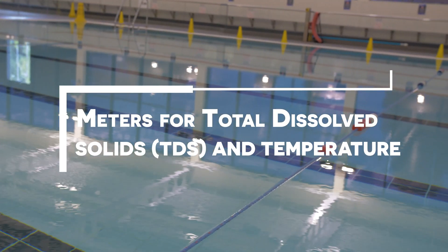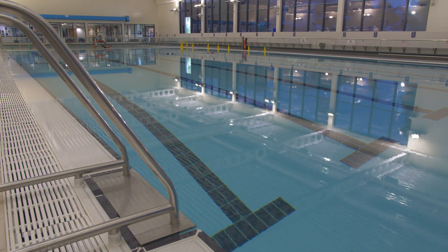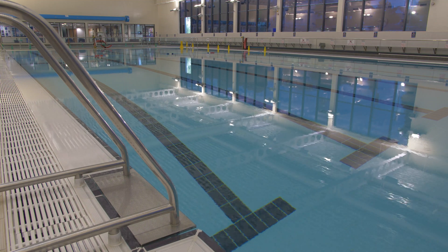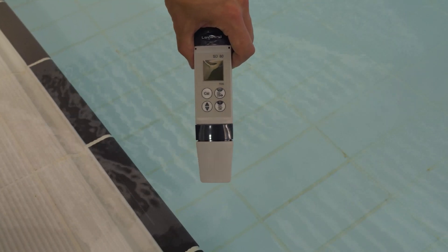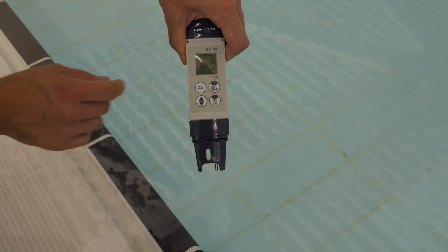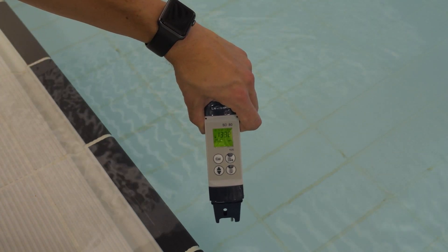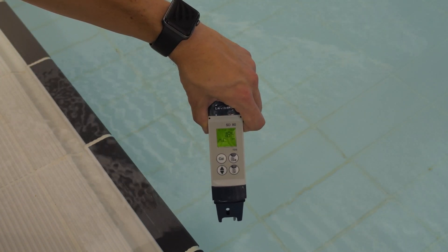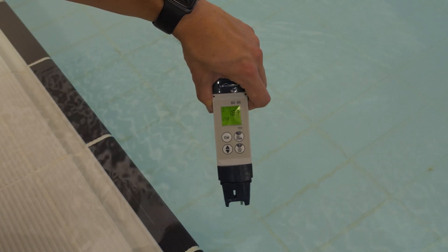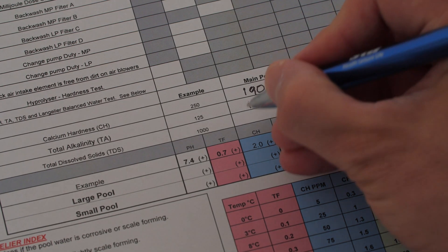Meters for total dissolved solids and temperature give direct on-screen readings and can be used either in the pool or by using a suitable sample container. Switch on the meter and submerge the probe for several seconds. Press the hold function, remove the meter, check the readings and record the results.